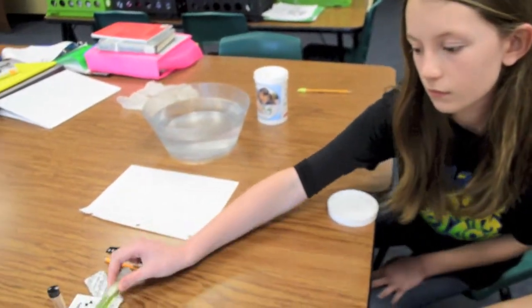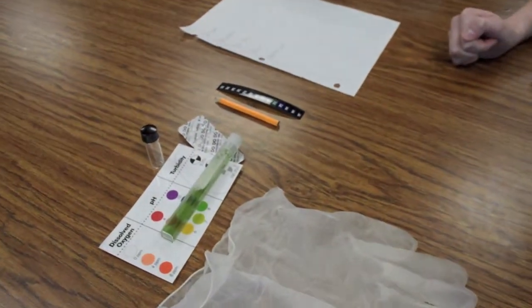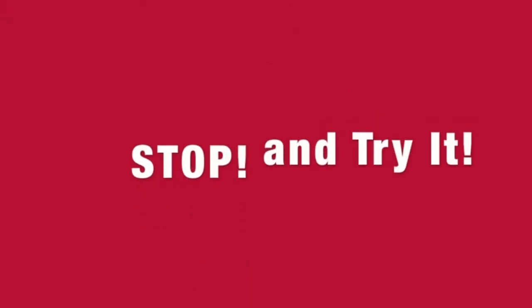Compare the color of the water sample to the pH wide range color-coded chart. The color should be in a range of 6.5 to 8.0. Record it on a piece of paper. Stop and try it.